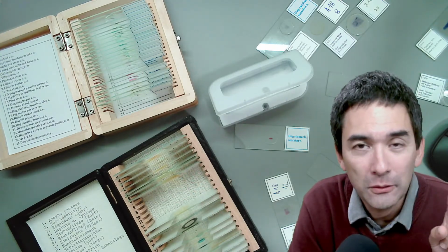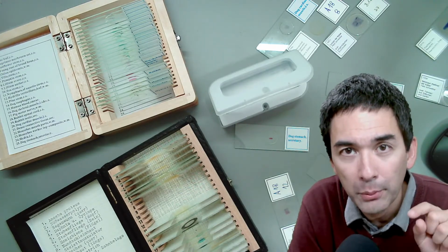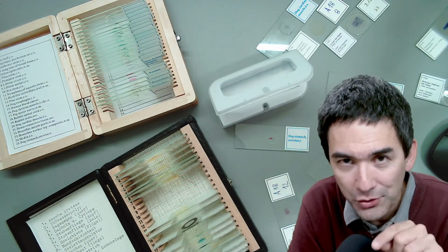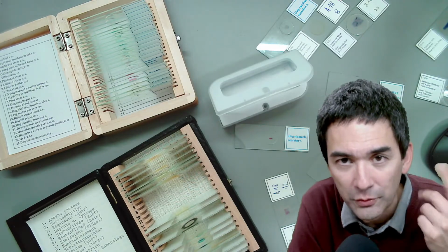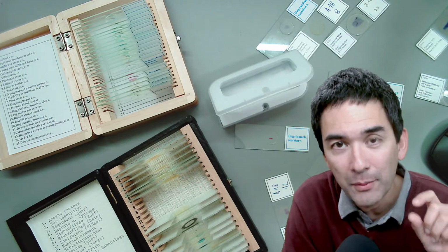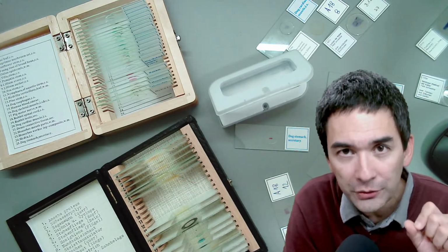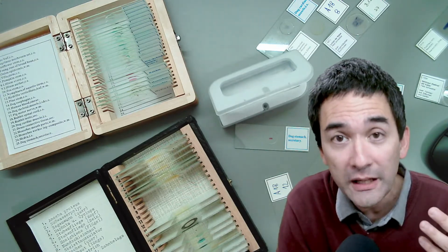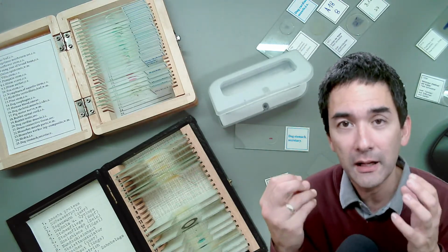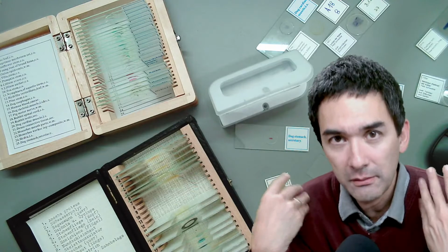For example, if you watch the video in my main channel where I put my contact lenses under the microscope, it's one of the recent videos. I was actually able to see a few white blood cells on my contact lenses. I was wondering, what in the world do they do there? But I think that they are naturally present to clean up possible bacteria that are on the eyes. That's my hypothesis.